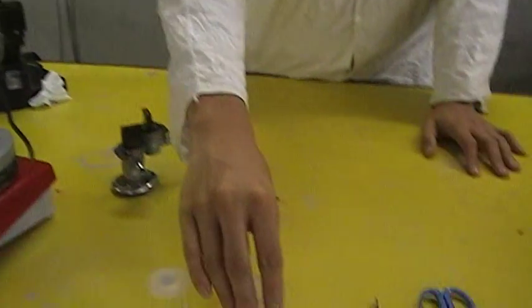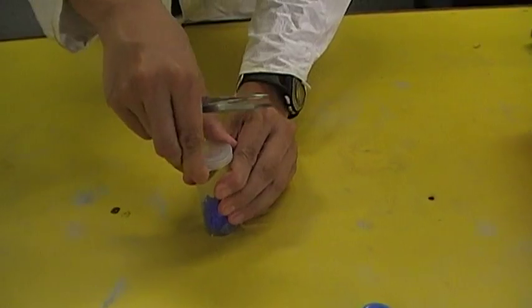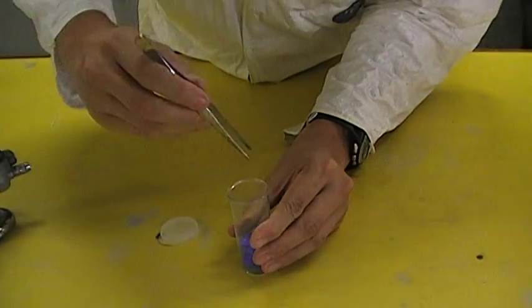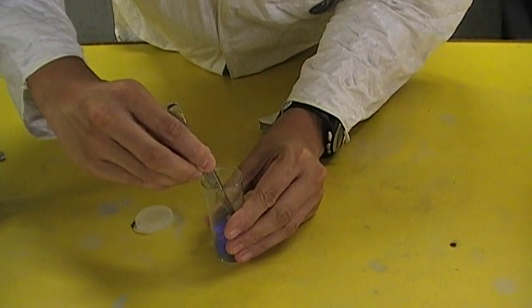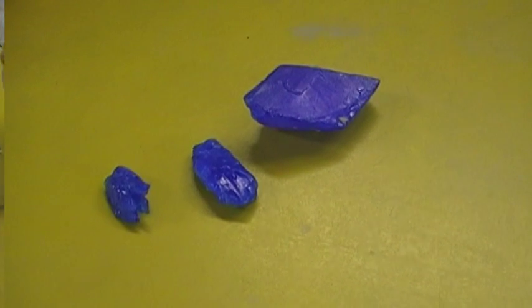First of all, we have to use a funnel stand to hold the crystal of copper sulfate. See?